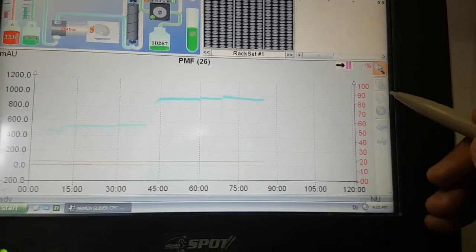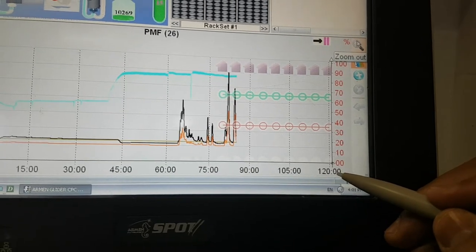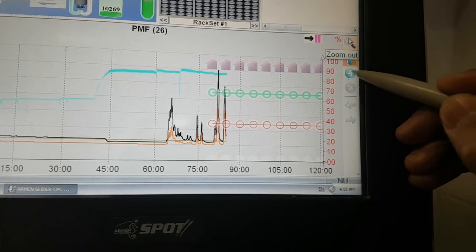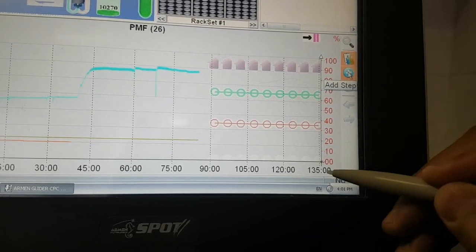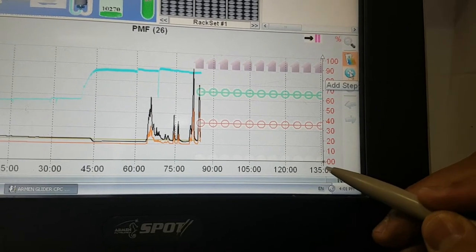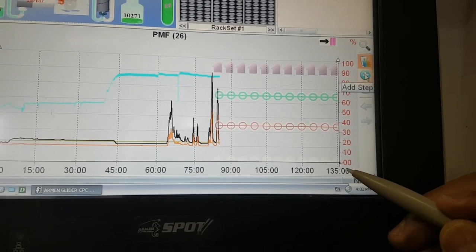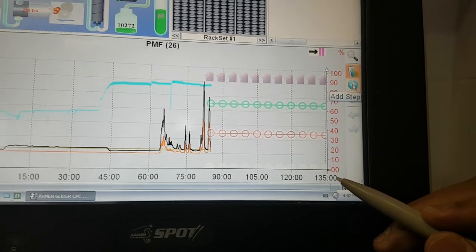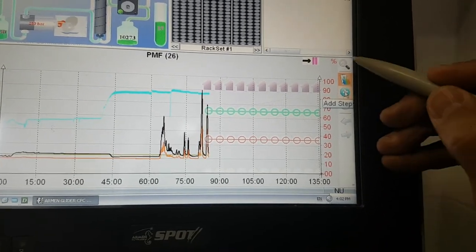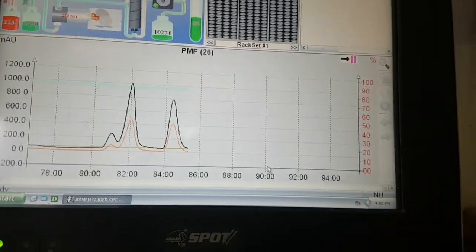And as well, you can increase the time. For example, here we have 120 minutes. You can press here. Now we added 15 minutes. As long as you still have some amount from your fraction, you can increase the time until finishing your separation.